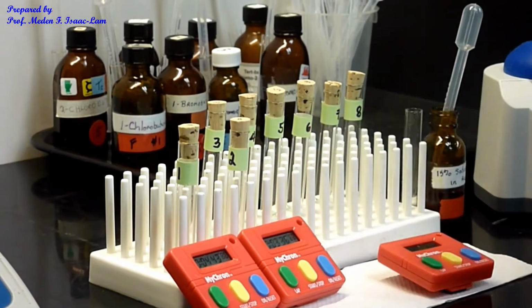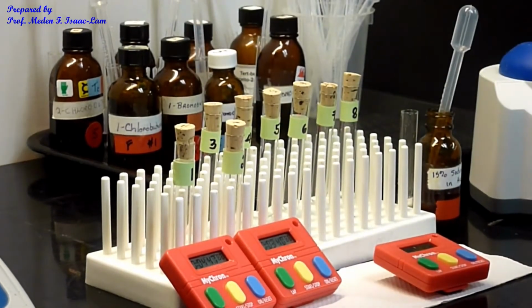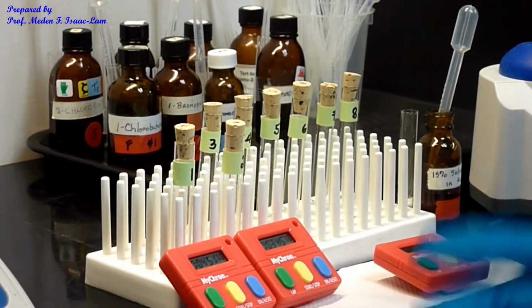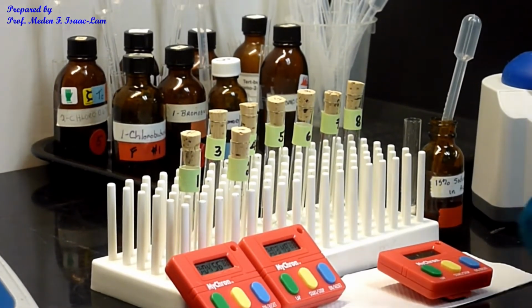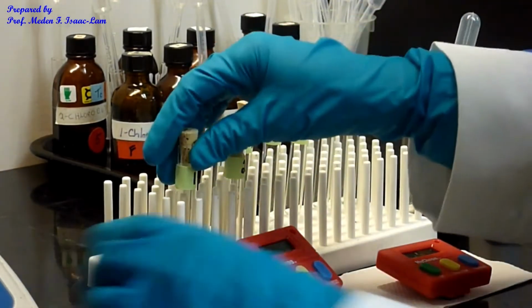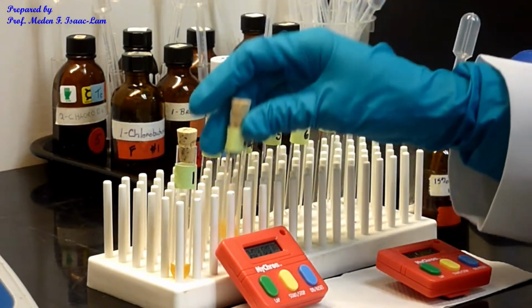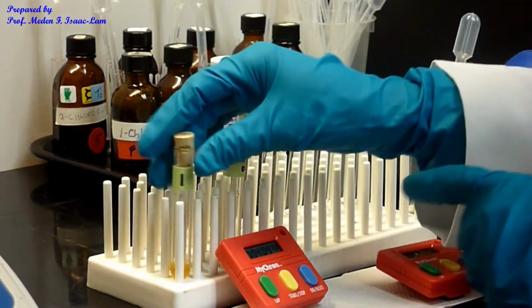So this one has more precipitation, number 2 sample, compared to number 1. Obviously we don't have to heat this up because it already formed precipitate before 5 minutes. Okay, so I stopped that one. And then this one, for almost 4 minutes, right? So this one has less than number 2.